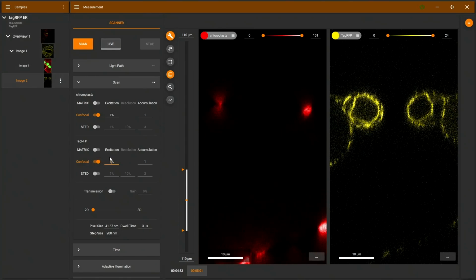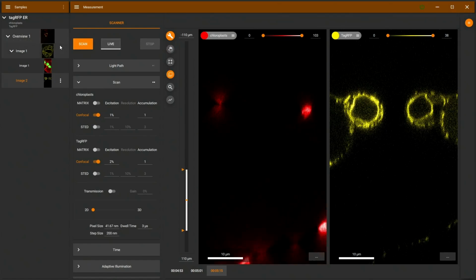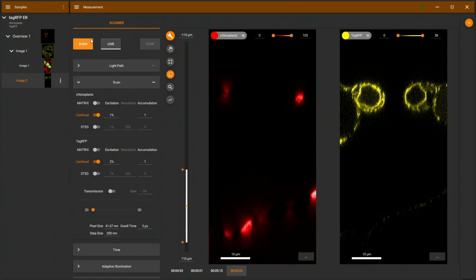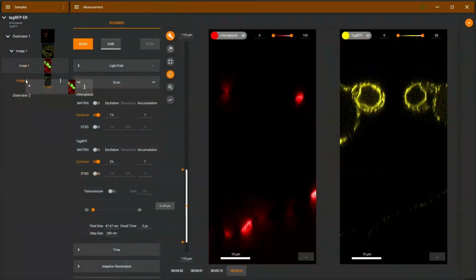I'll ramp up the excitation power a little bit just to see a little bit more on the bottom here. And thanks to our APDs, we can really see structures also deeper into the leaf. Go a little bit further. There we go. I will now go to our STED image. And from there, I can transfer the settings to my vertical image. Now we have already the STED on. I just need to use this slider here to go from 2D to 3D STED.